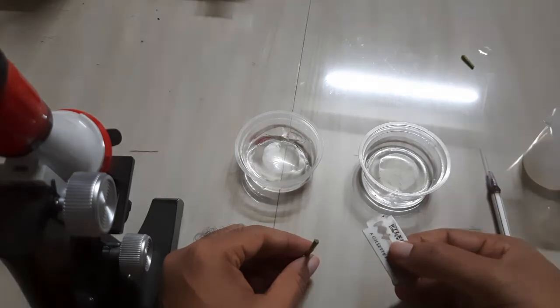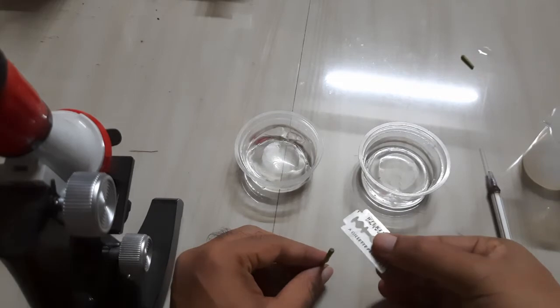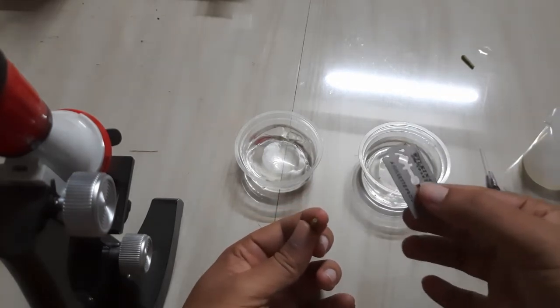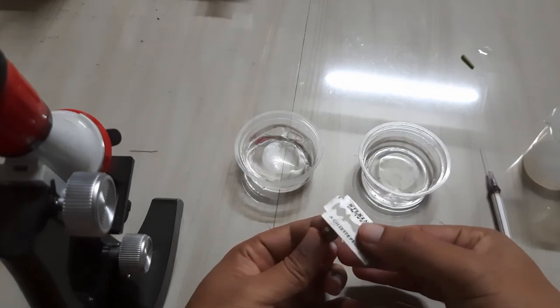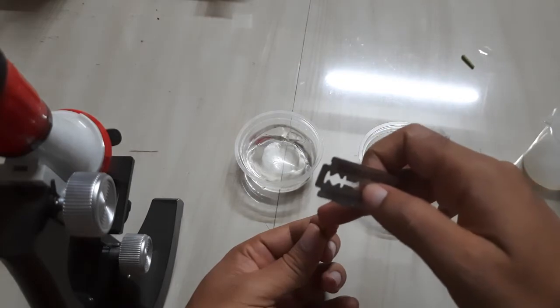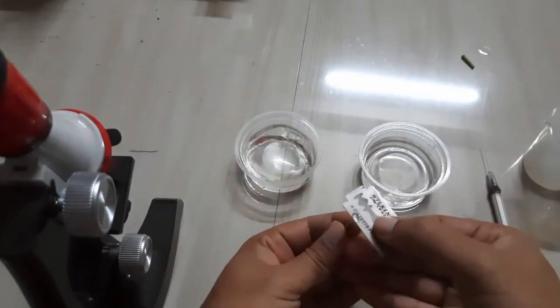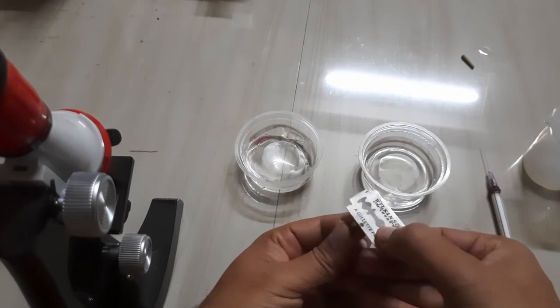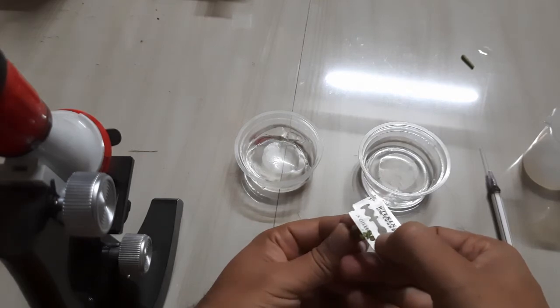You have to hold the specimen in this manner and hold the blade in this manner, and then you have to cut. So let's do this practical. First you have to add a little water. Hold the specimen like that way and then cut like this. Mind it — the section should be very thin.